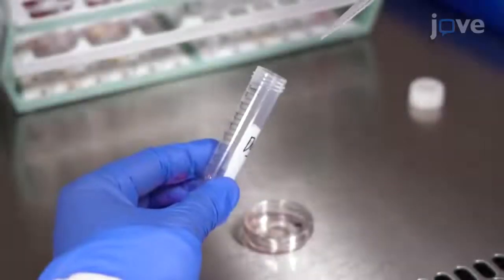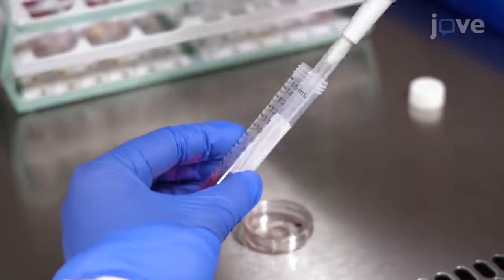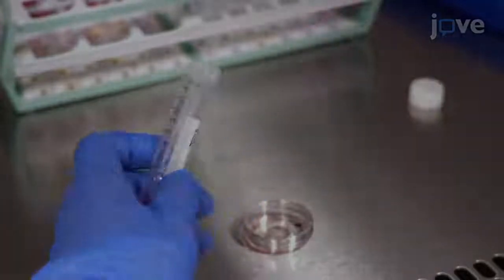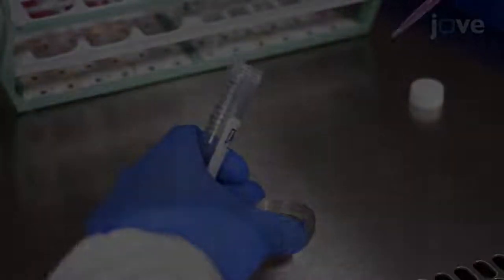To visualize mitochondria along the axons of forebrain neurons, first stain the neurons with 15 nanomolar dye.